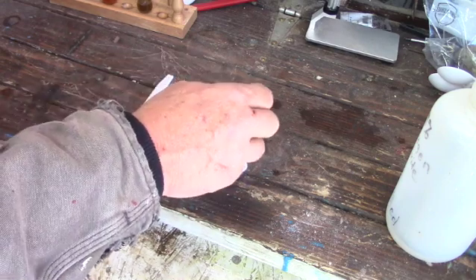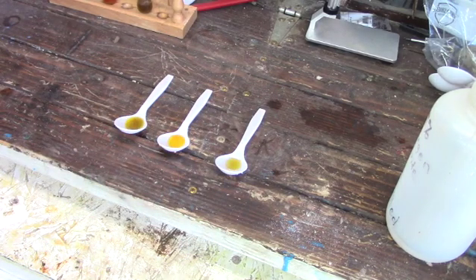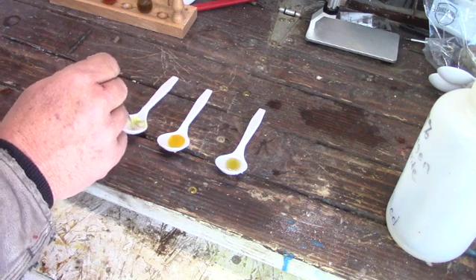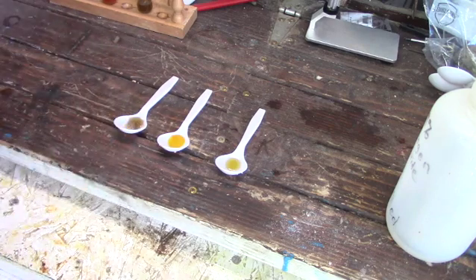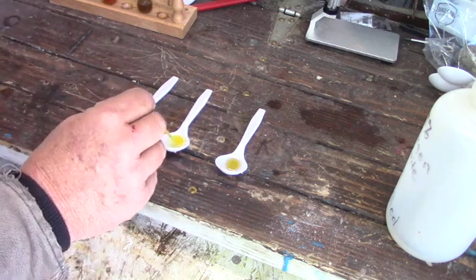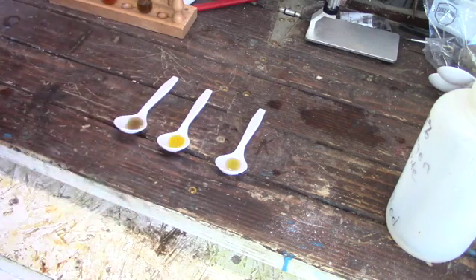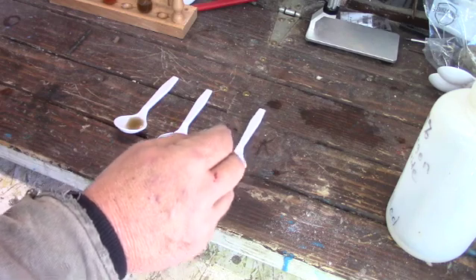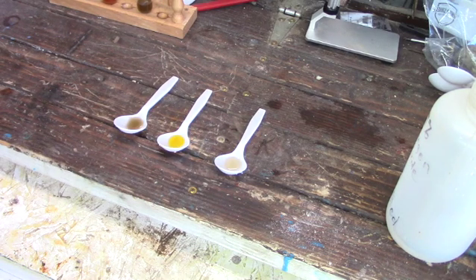Sample A indicates that there is gold. Sample B is kind of unchanged. We'll go through and stir these and see if we get the same results. You see, after de-noxing, sample B does not indicate as much gold as it did before. And sample C has actually gone clear. So we lose on sample C, but A and B are processable.